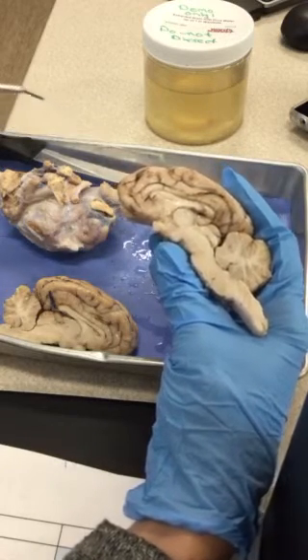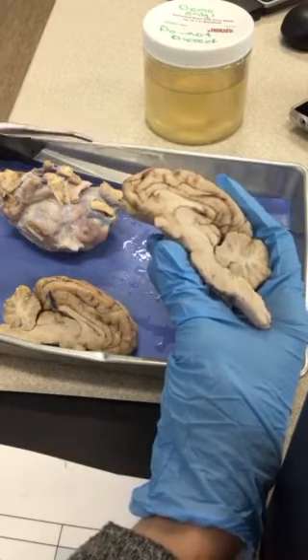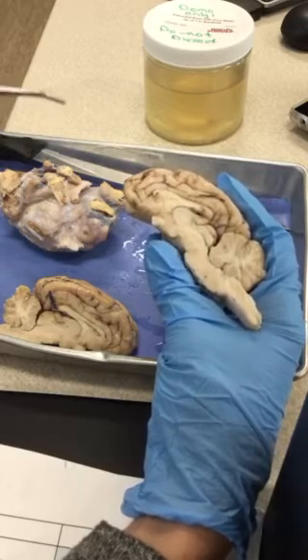So once we do an overview, then we're going to have you point to each part, and I'll walk around and Deke and I will verify that you can find each part. We'll kind of go through piece by piece.